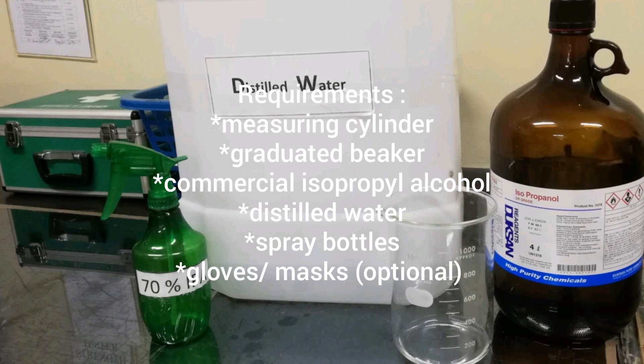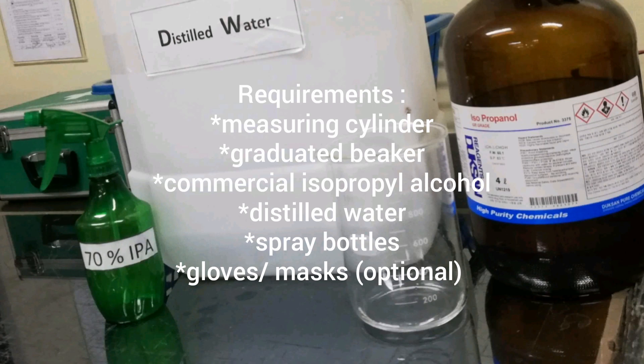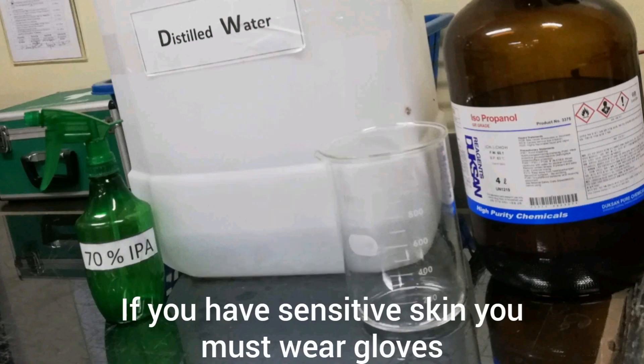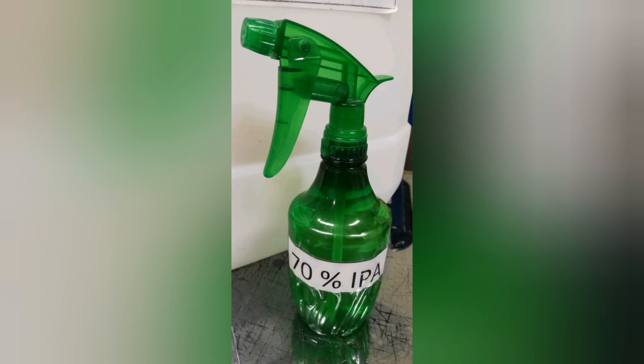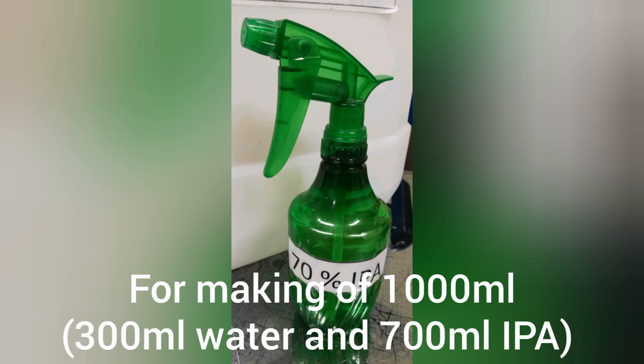Requirements are: a measuring cylinder, a graduated beaker, isopropyl alcohol, distilled water, a spray bottle, and gloves or a mask — optional, but recommended if you have sensitive skin. I have a labeled spray bottle which I use in my lab for testing or any other purpose.